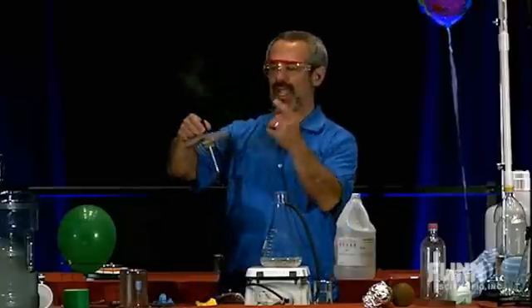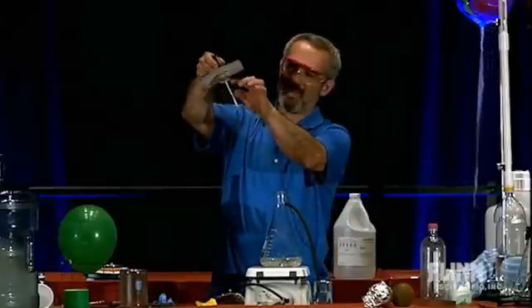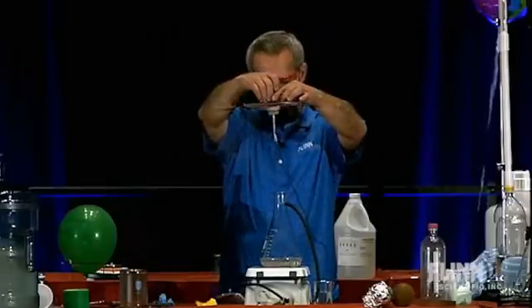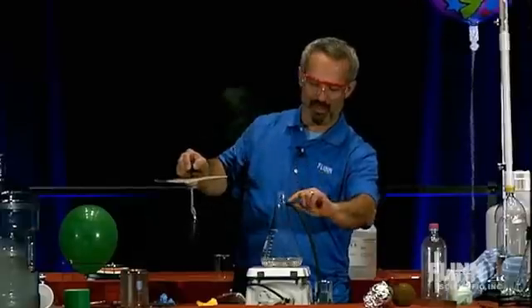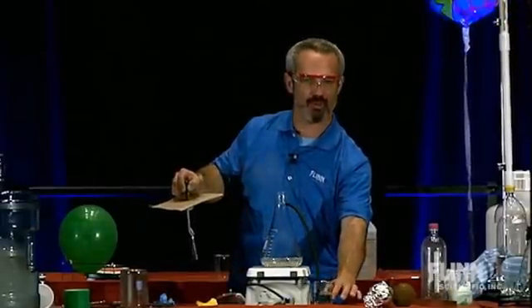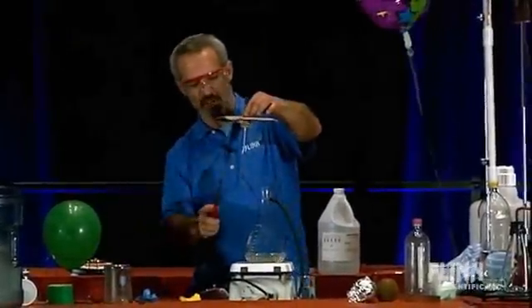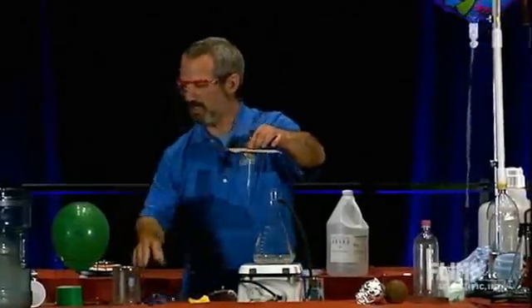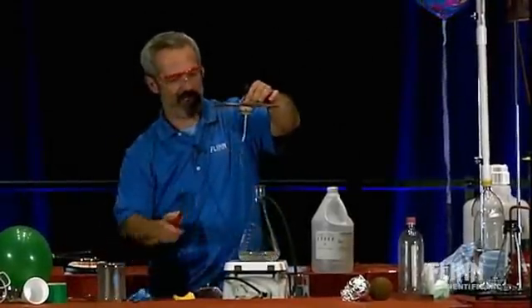This is in the handout. This is just a stopper — hold the stopper with a little coat hanger. I'm going to light this and lower it down there. I've got a vacuum flask with a little side arm and a tube going into some soapy water — a little beaker of soapy water that's off the hot plate. By the way, magnesium burns with a pretty bright flame.